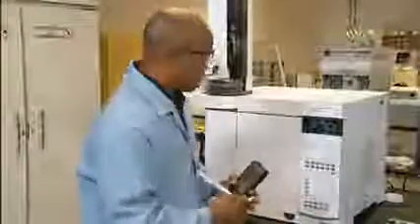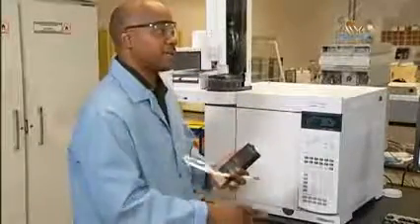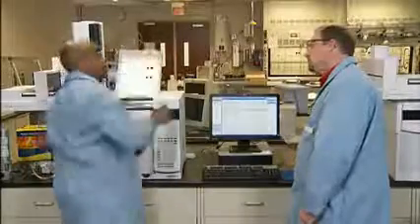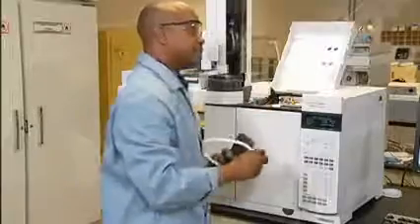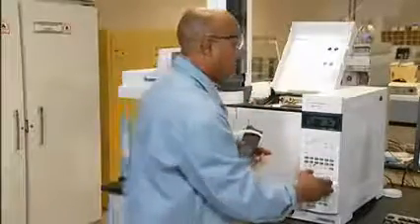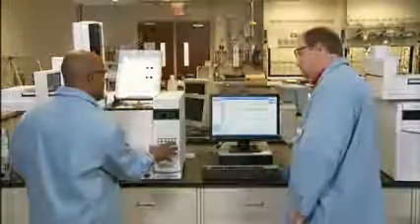Okay. First, we need a flow meter. Now, we will verify the hydrogen and airflow, which is the support gas for the FID flame. We will measure this flow at the top of the chimney with one gas at a time. We will turn our airflow off, and we can do this either from the software or at the panel of the GC.